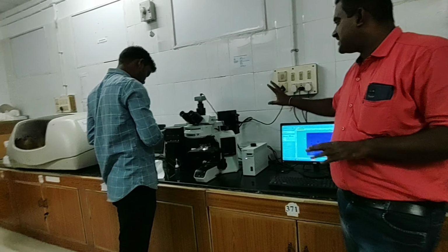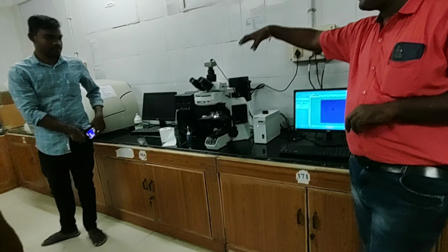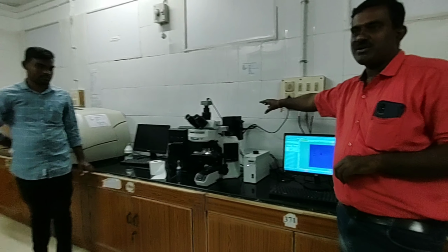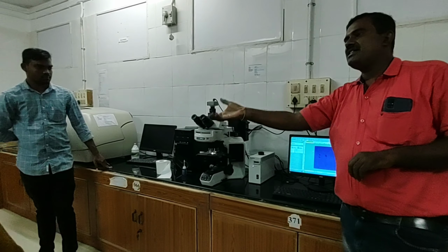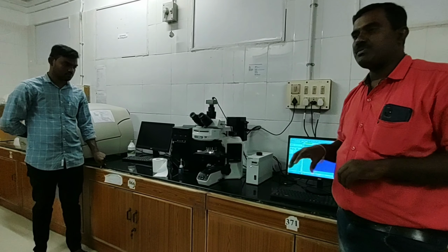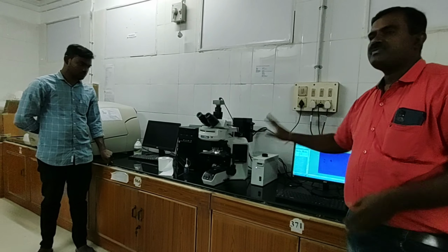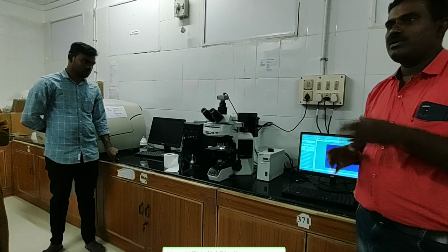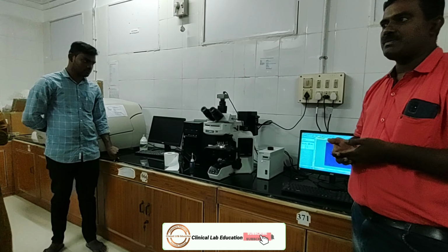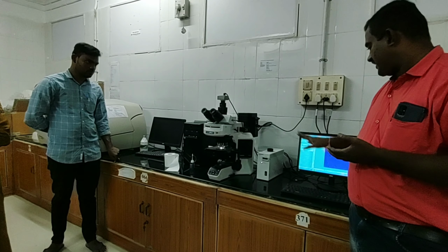The remaining extra is the fluorescent bulb, which is a mercury fluorescent bulb, and the camera is fitted. It will come from the horizontal position, and the fluorescence will expose from upward to down. So during that time we need to close the down light so it doesn't clash, otherwise reflection will happen and the images may not be clear. That's why we need to close it. Then we have to take the image.